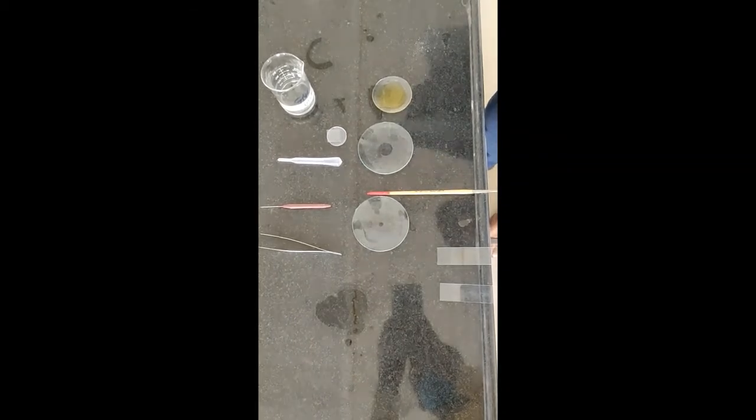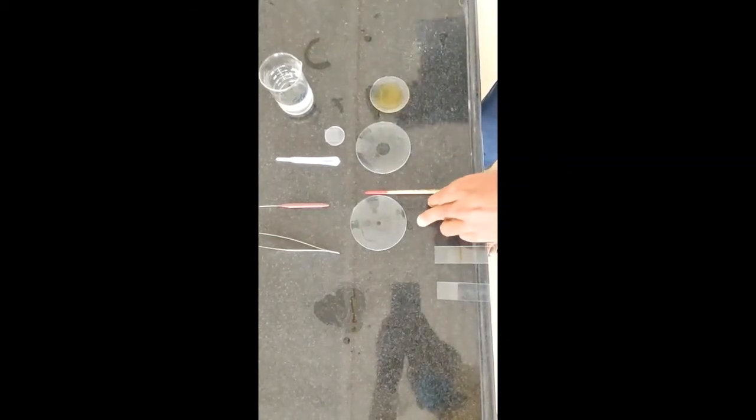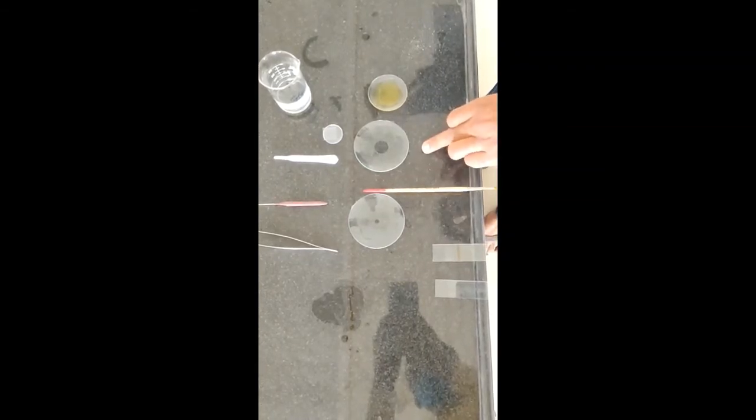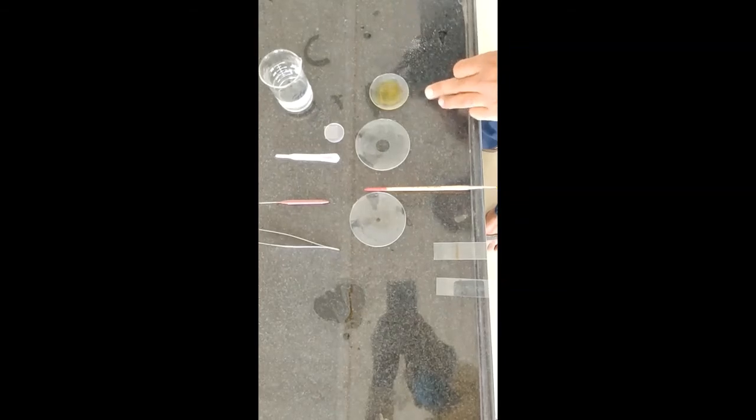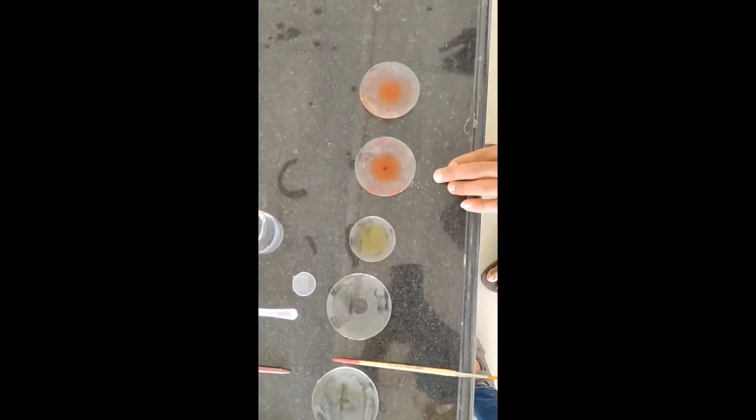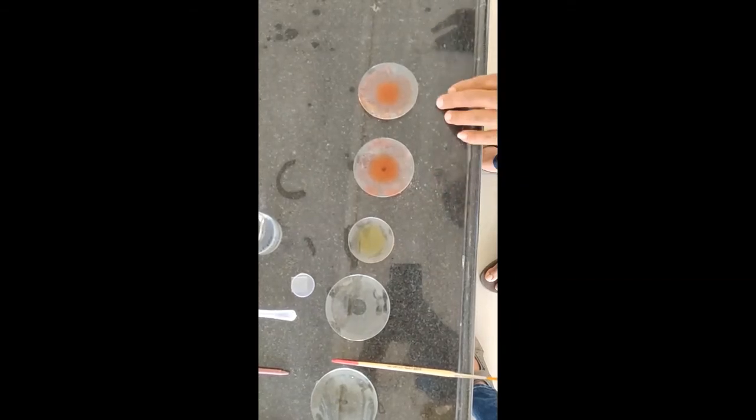For today's practical, we need some chemicals and apparatus. This is phloroglucinol, this is concentrated HCl, and this is iodine solution. These are the watch glasses, this is a slide, a camel hair brush, forceps, needle, dropper, cover slip, glycerine water, ruthenium red solution, and Sudan Red III.